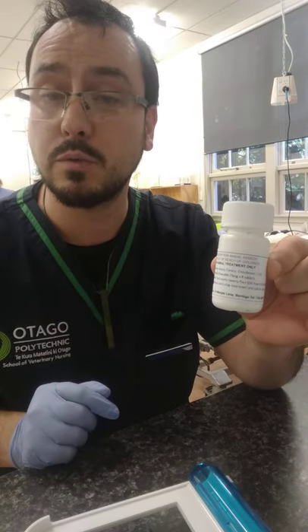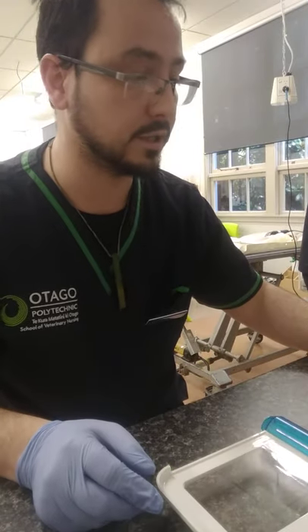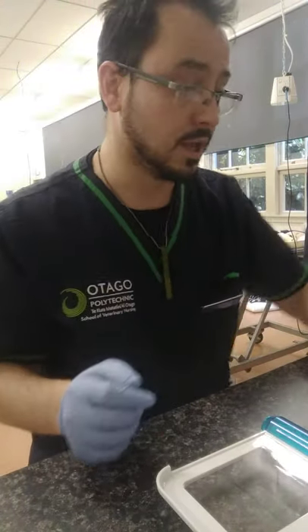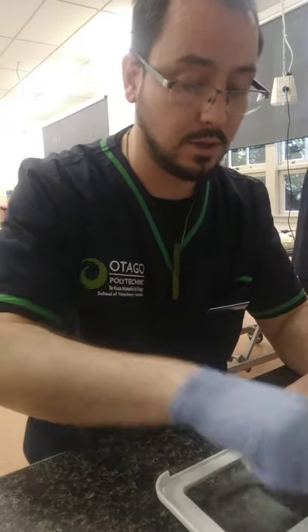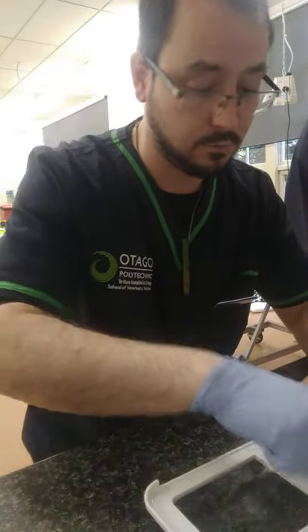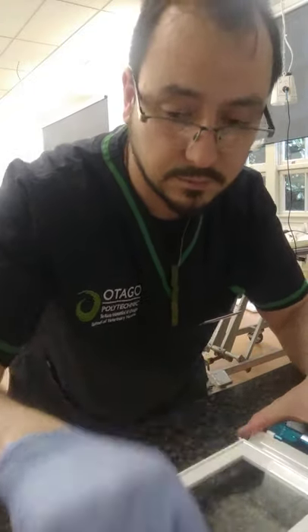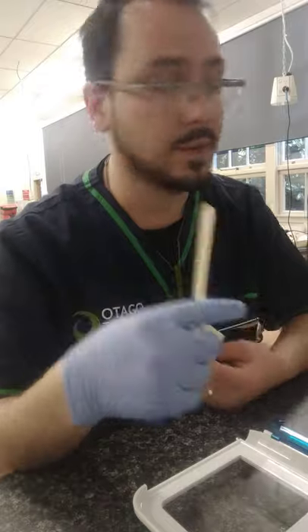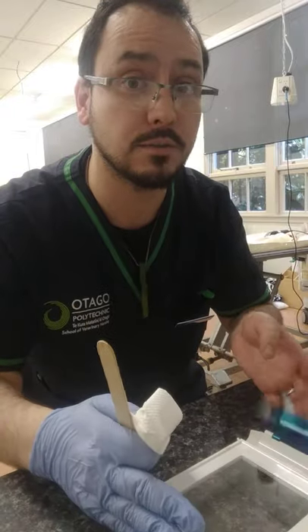Let me just make sure we gave it to our patient and they get charged correctly for it. And finally, I'm done with using this, so I'm going to clean up. I'll take my spray again and wipe down the tray. The wooden swab can be discarded because it's wood, but if we had a plastic one, we could sterilize it and reuse it. And that is all. Thank you.